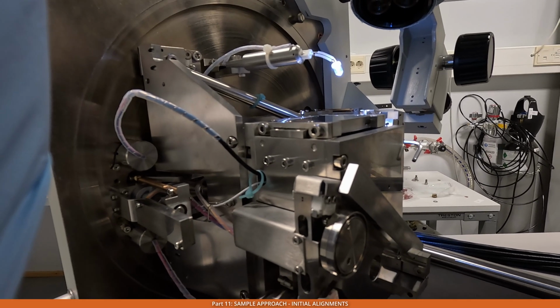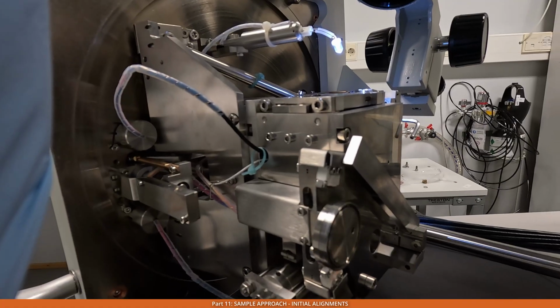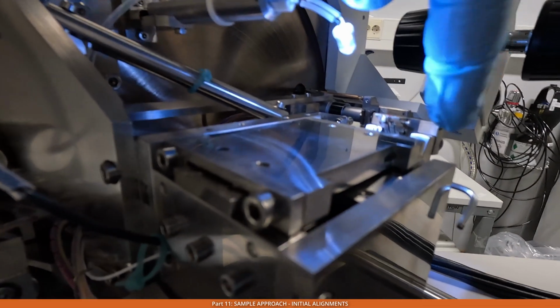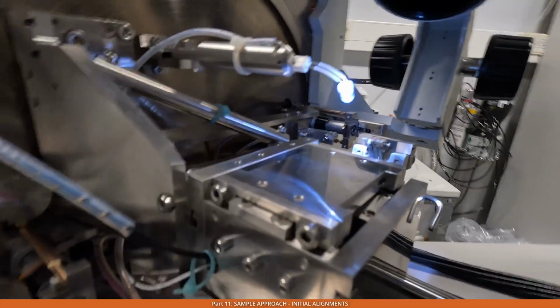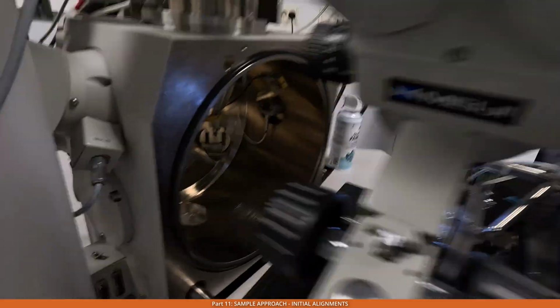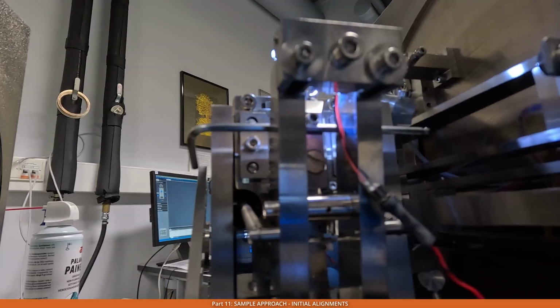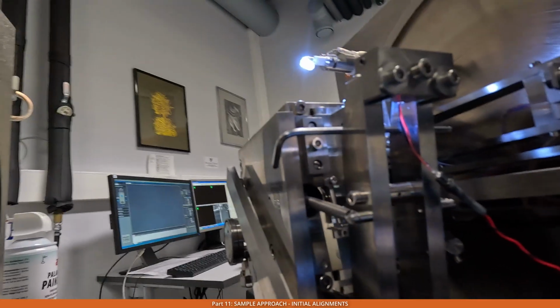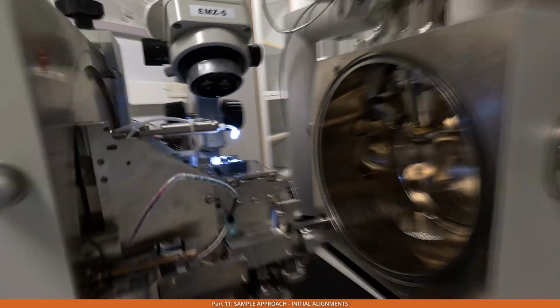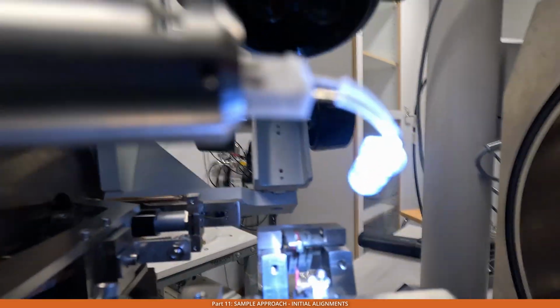When we press the microtome button, the lever which holds the knife moves, but the knife is not moving because it's fixed with this hex wrench there. Let me show you how it looks from the other side. Yeah, it's quite difficult to see. But the idea is that we just make sure that the knife doesn't go unless we really see how it goes. Now we'll look again from this position.